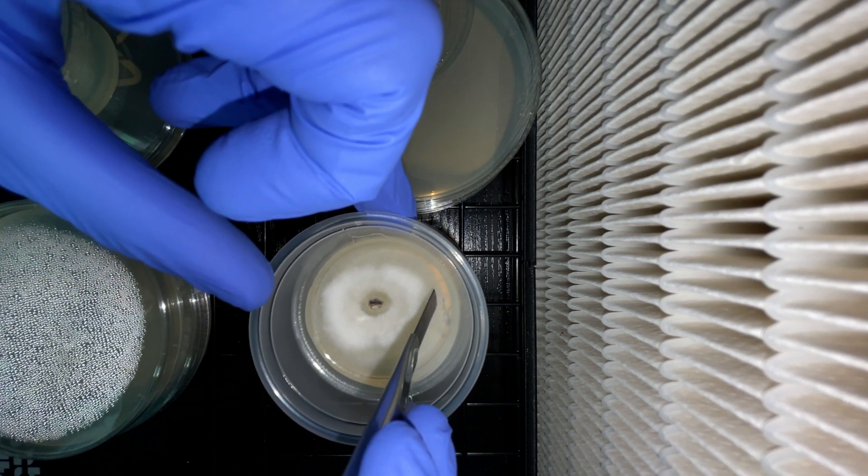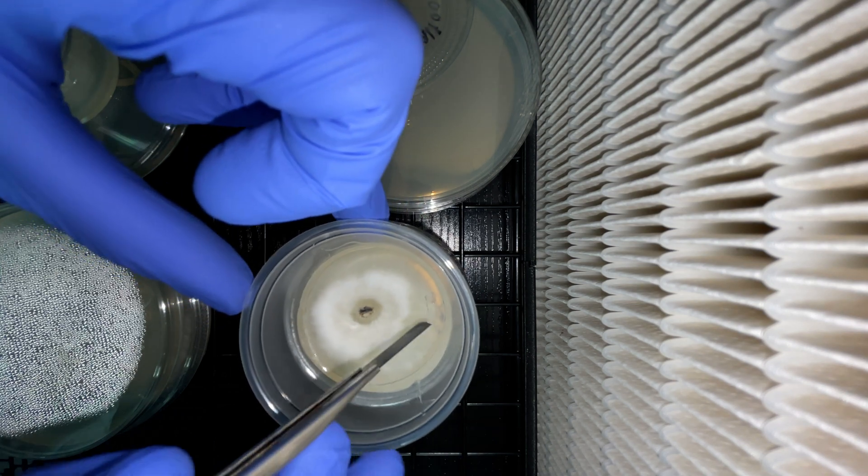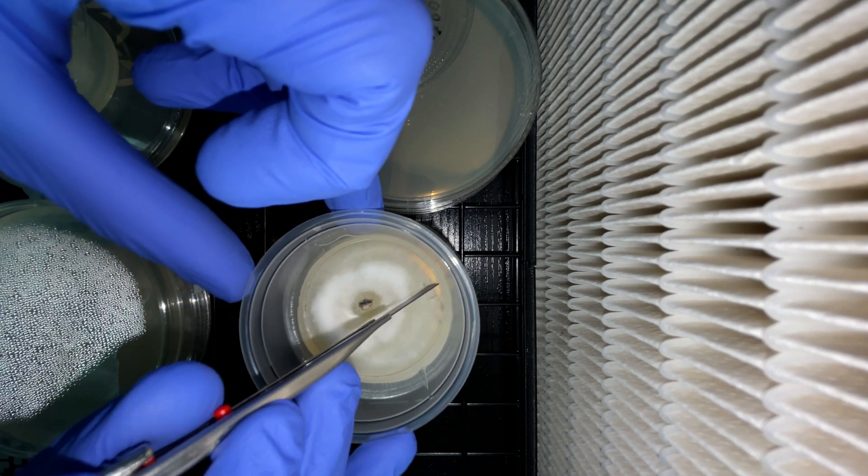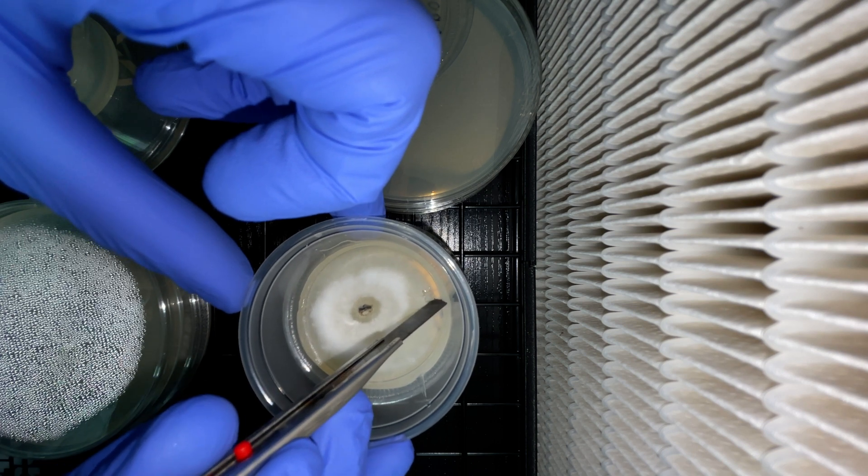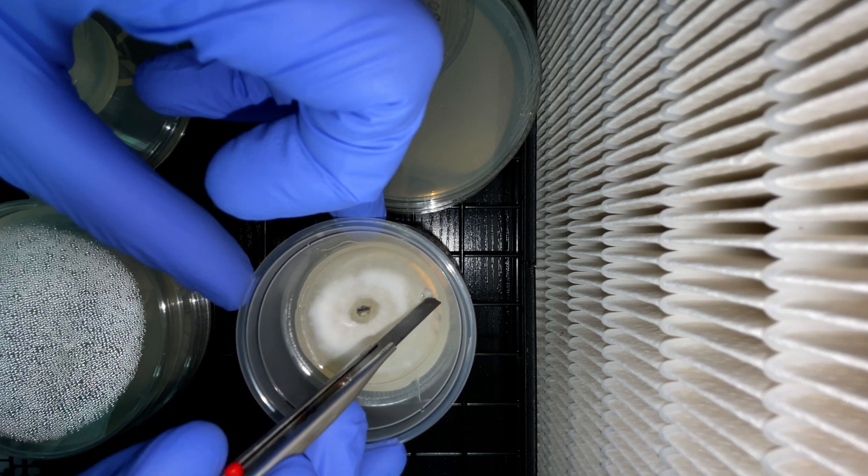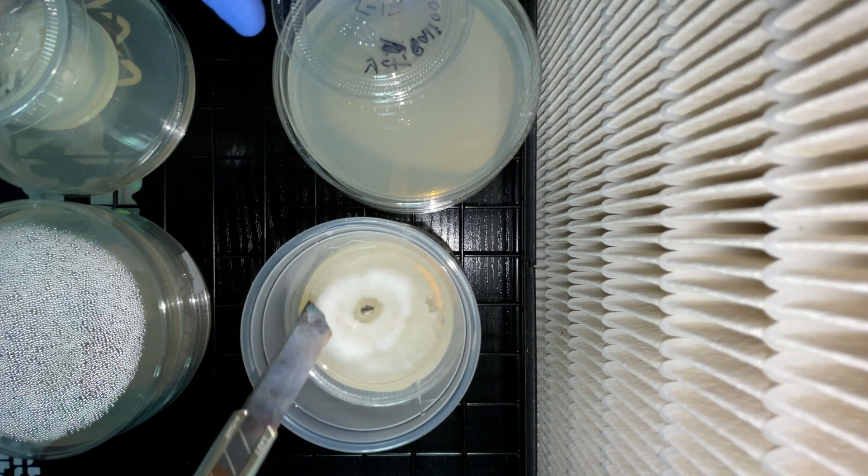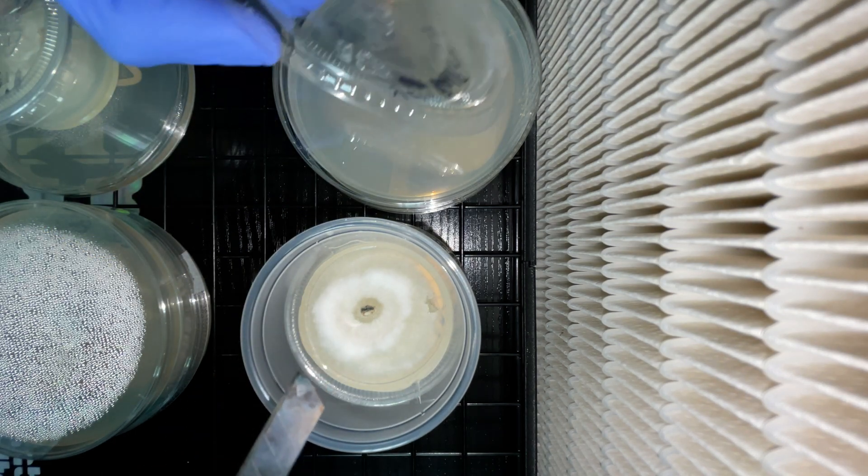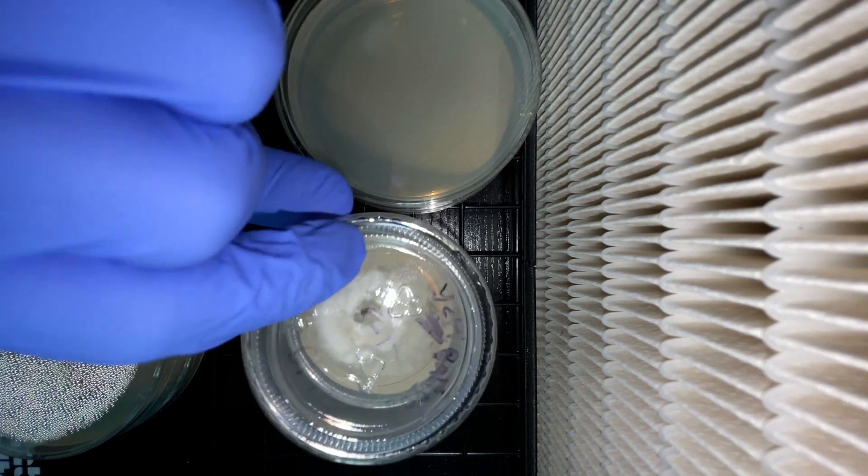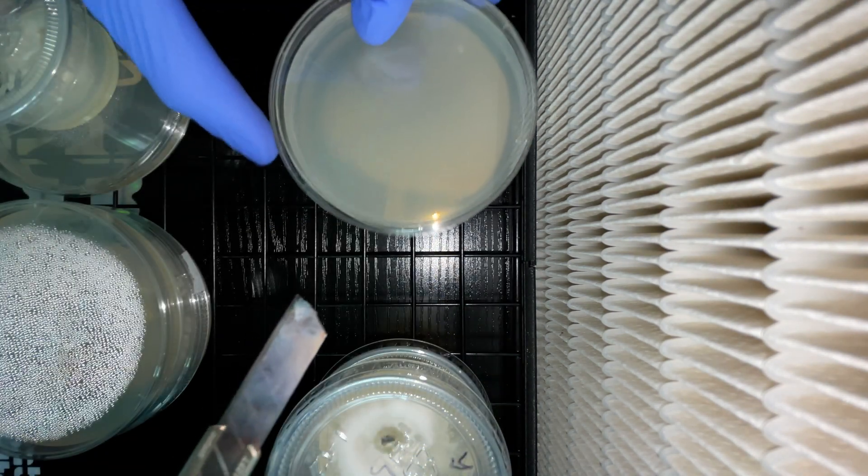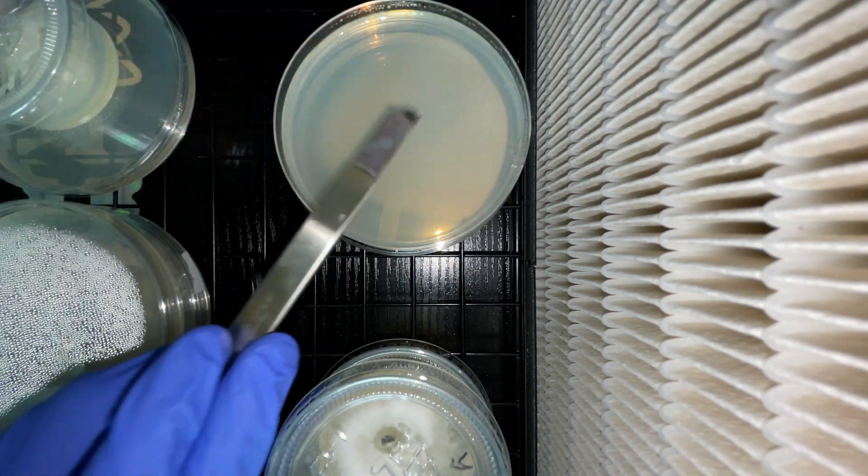Real quick I also like to say with these, I like to look for the smaller transfers on these as it should be able to isolate a little bit more and give me a lot less chance of contamination as I'm bringing less agar over.